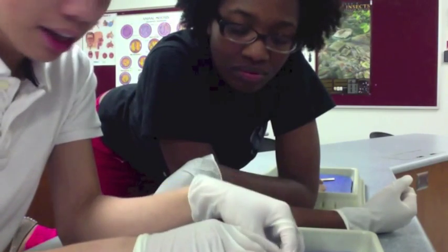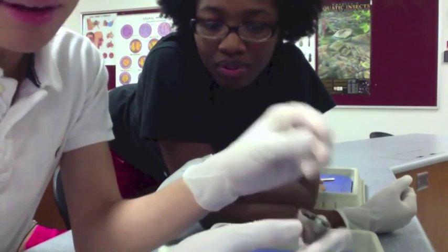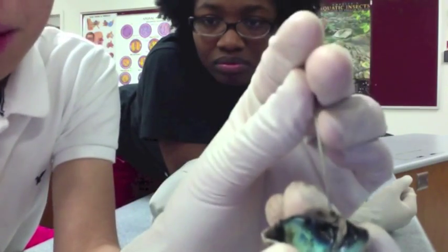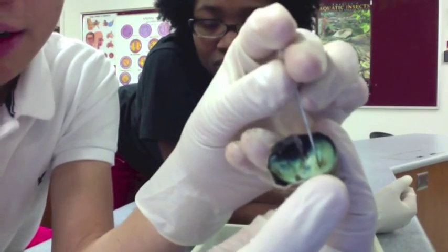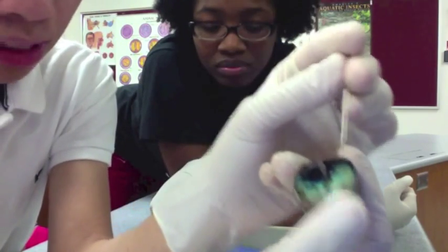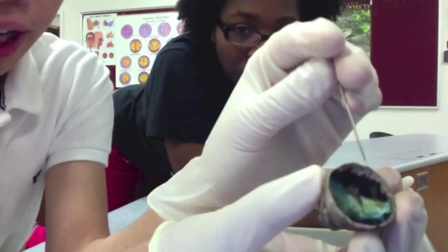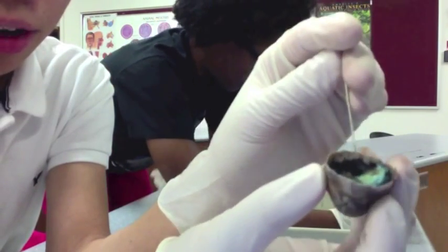You also have your retina and other parts. You have your retina, which is the white part in the back right here. The black is the pigmented choroid coat, while this little bluish area right here — that's your tapetum lucidum. So the retina is actually like a layer under the pigmented choroid coat. The white is your retina, then you have the black, which is the pigmented choroid coat, and then you have the blue layer, which is the tapetum lucidum.